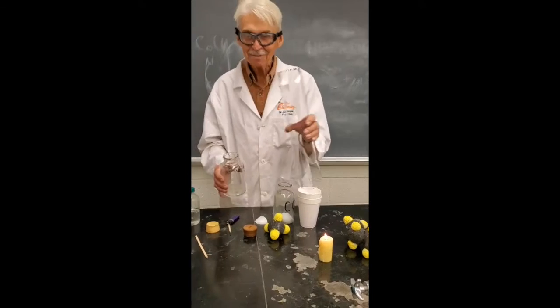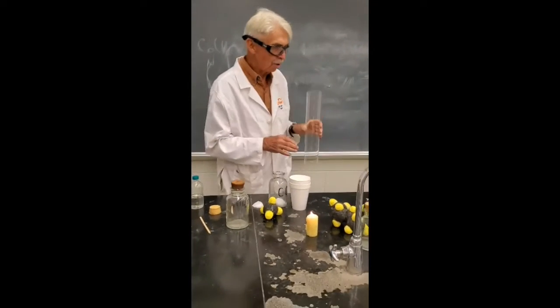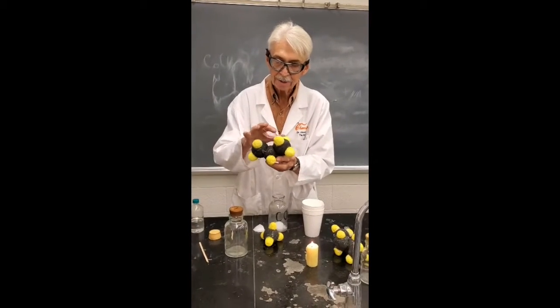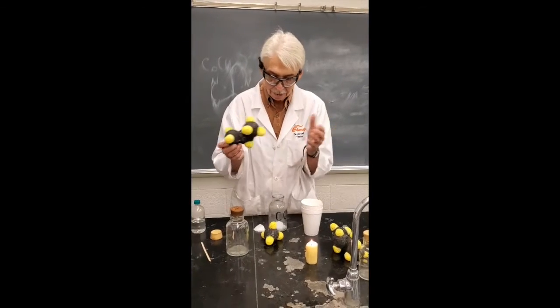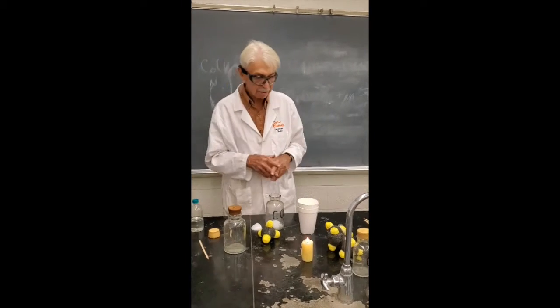Did you see that, everybody? That's a little bit dangerous to do, but if you know what you're doing, it's all right. This is what we were burning. So all the carbon atoms in here ended up in CO2 when they burned. The hydrogen atoms end up in water again. So all hydrocarbons burn, and they make CO2 and water.